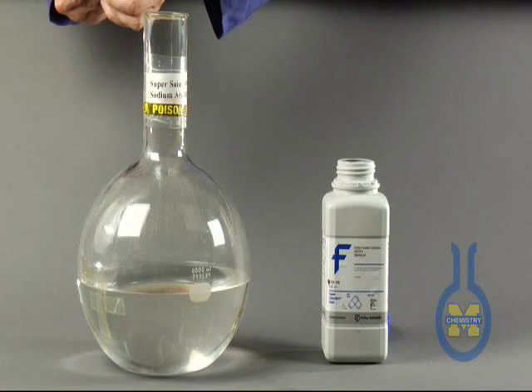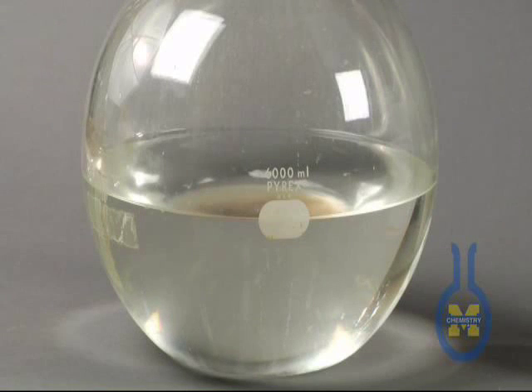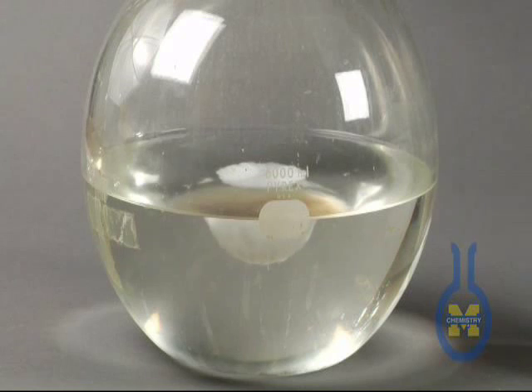So there we are on camera and you can see a solid appearing. We say that's precipitation, not like an ordinary citizen says, oh, it's precipitating.